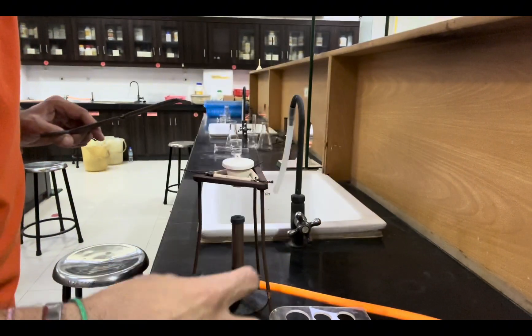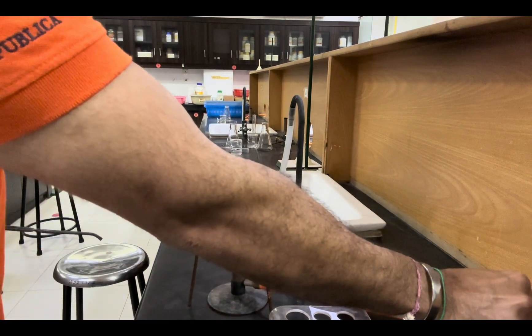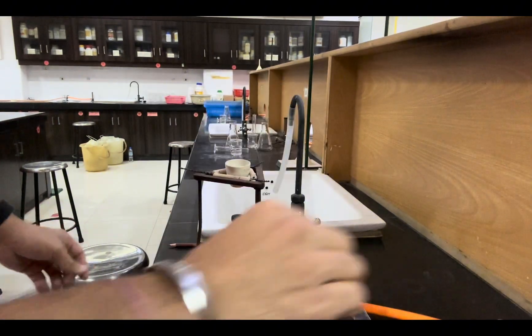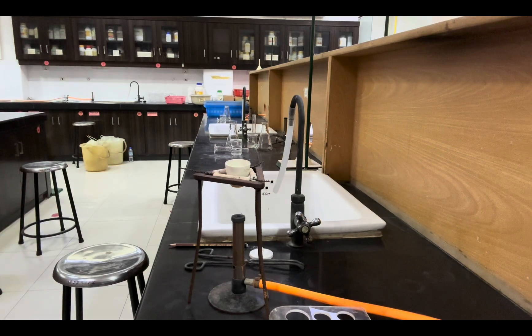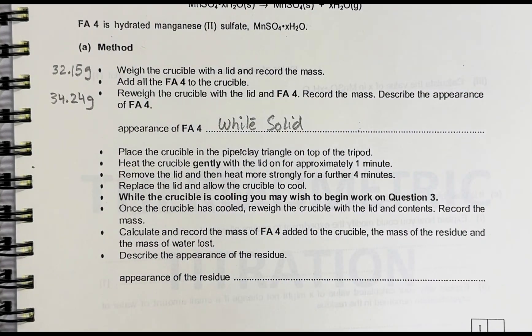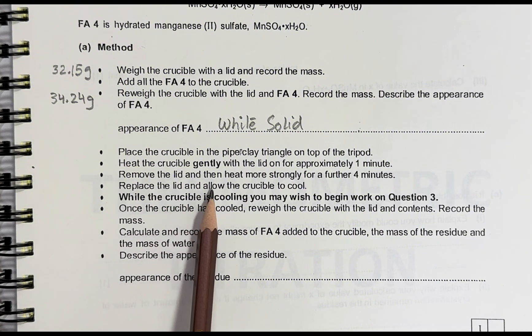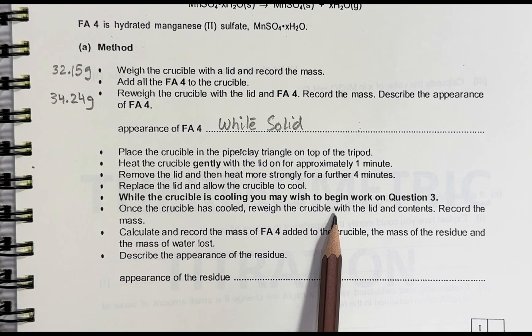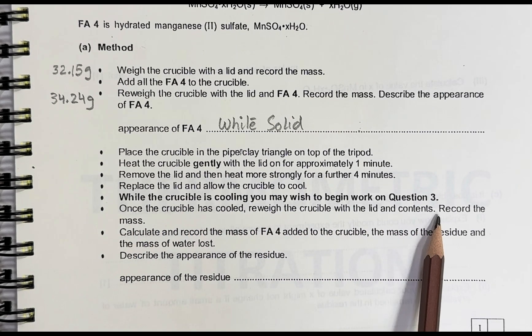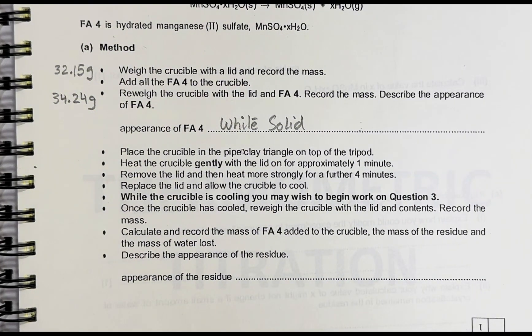At one minute, do not stop the stopwatch — just remove the lid and increase the flame. At five minutes, stop the flame. Now let's move on to the next part. After heating for five minutes, the next part says replace the lid and allow the crucible to cool. Once the crucible has cooled, re-weigh the crucible with the lid and the contents, and record the mass.